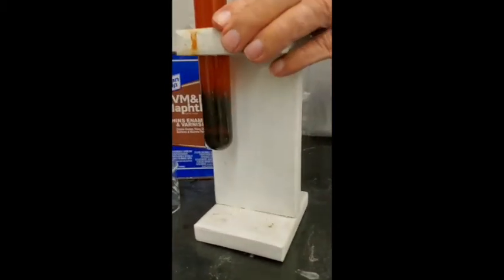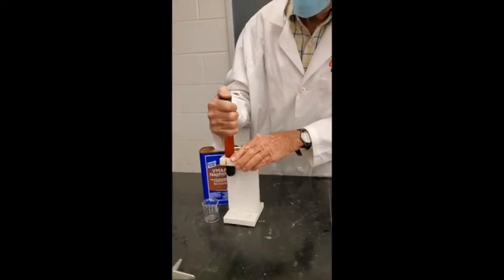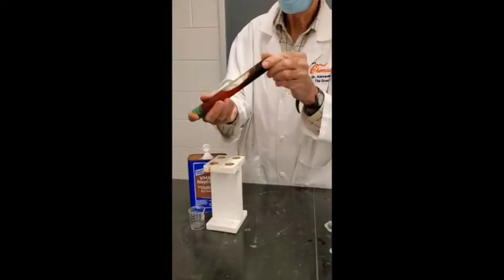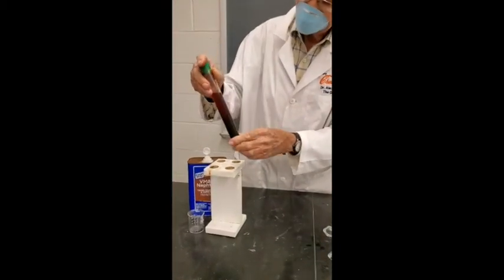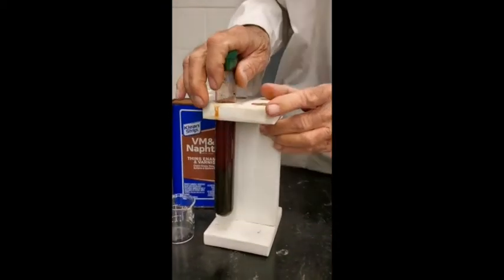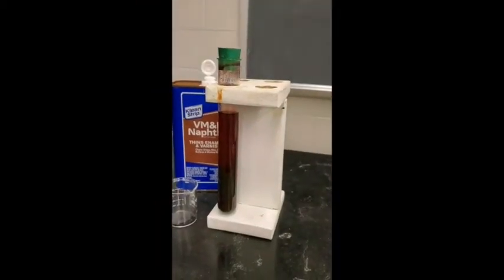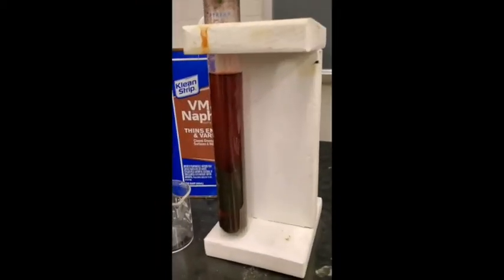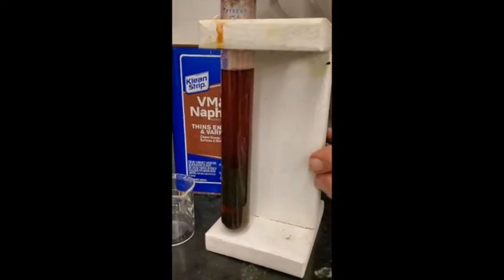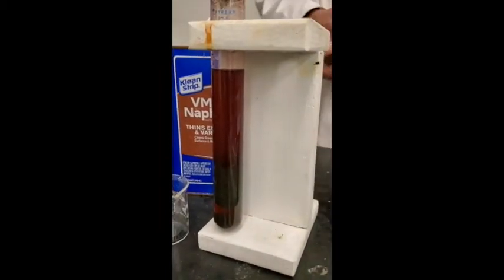And shake it up a little bit. Whoops, it's kind of tight, isn't it? Now let it settle out, and I think you can see the purple color in the upper layer. Can you see it? Yeah, it's more intensely colored. And then that lower layer has triiodide ion in it, which is a dark brown color. This is the one with the triiodide, and this is the one with primarily the iodine, which is purple in color.